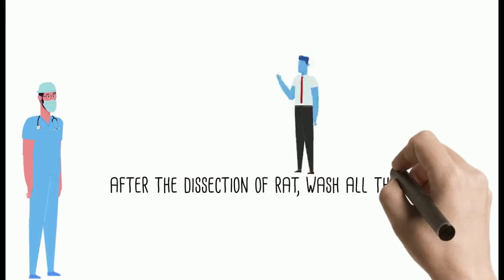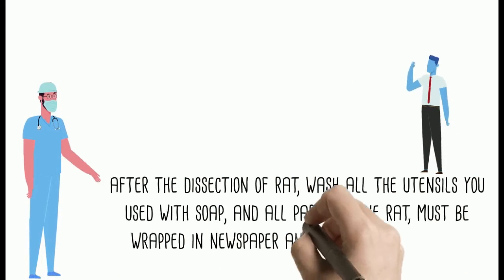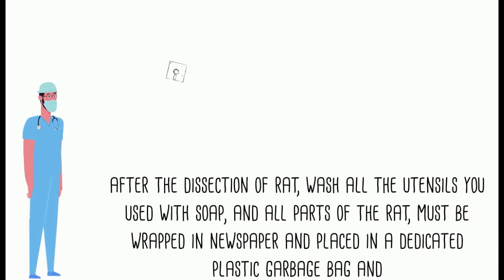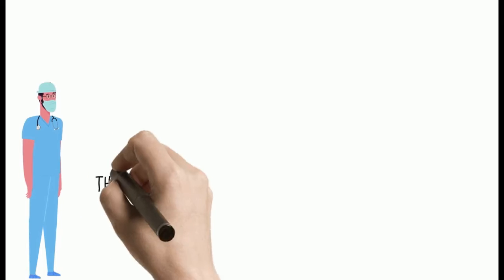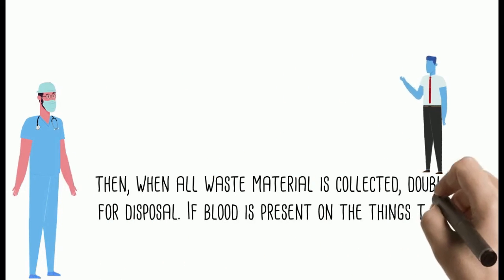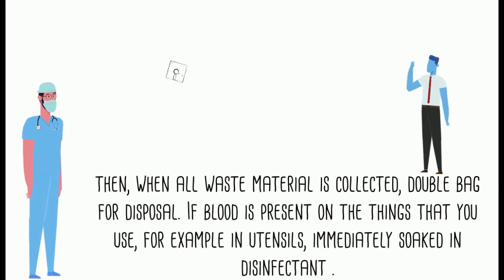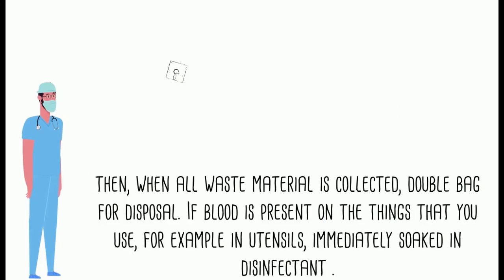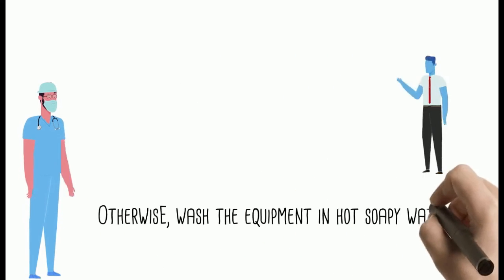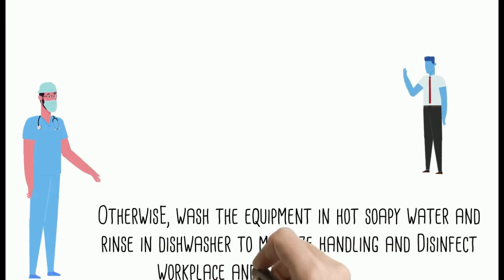After the dissection of the rat, wash all utensils used with soap. All parts of the rat must be wrapped in newspaper and placed in a dedicated plastic garbage bag. When all waste material is collected, double-bag for disposal. If blood is present on the utensils, immediately soak them in disinfectant; otherwise wash the equipment in hot soapy water and rinse to minimize handling and disinfect the workplace, and wash your hands thoroughly.